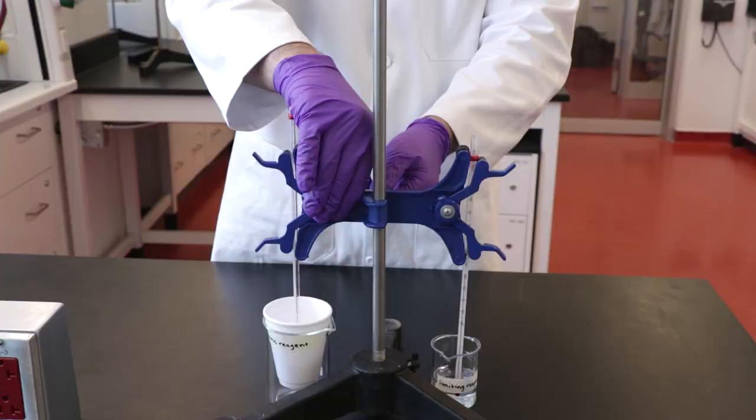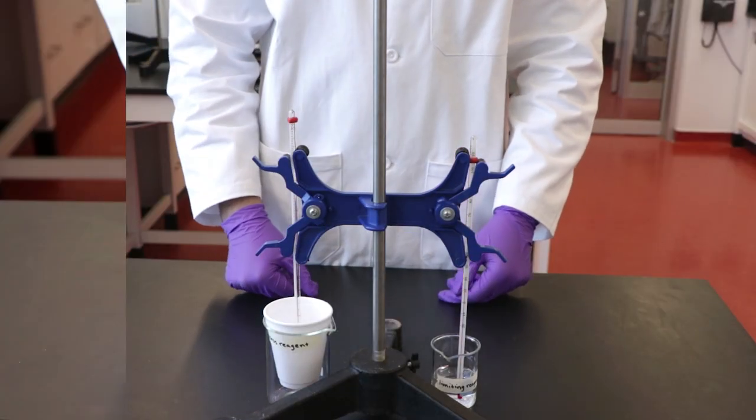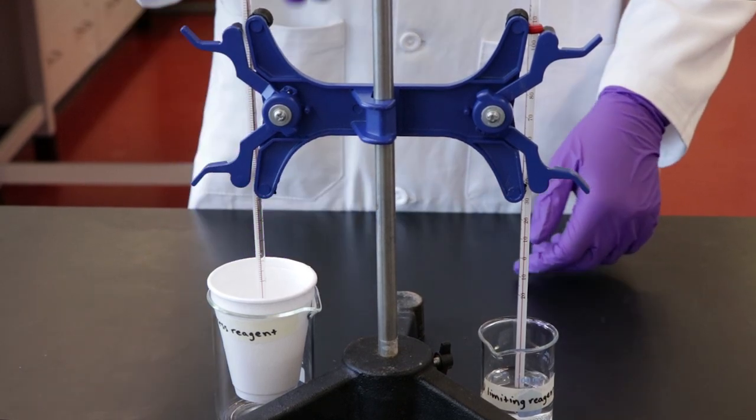Monitor the temperature of the two solutions and once they are 0.5 degrees from one another, record the temperature. Continue to do so for the next four minutes at one minute intervals.